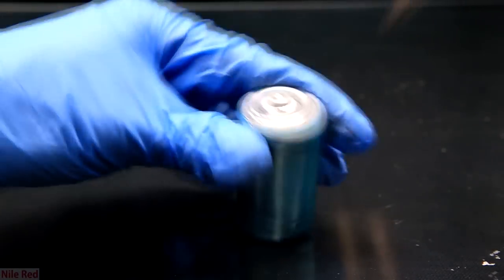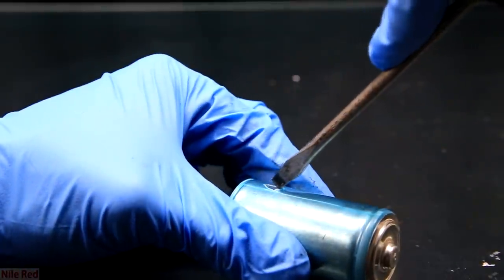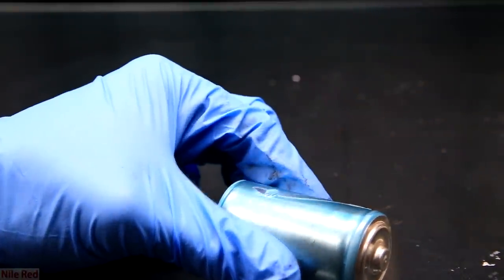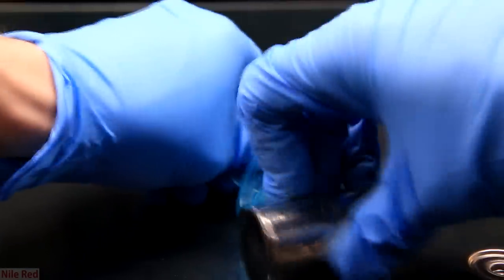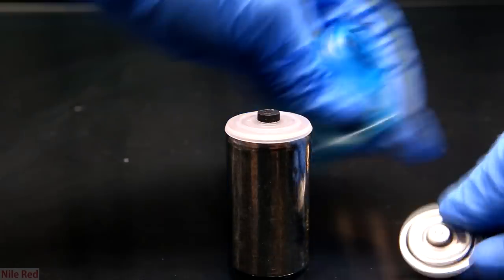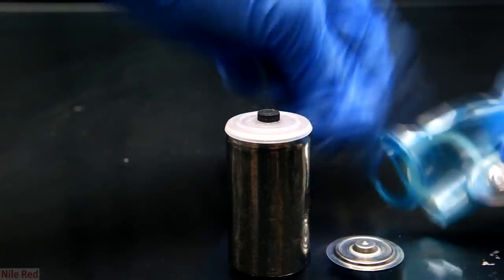So now we have our inner shell of the battery and the first thing to do is remove this plastic casing. The plastic casing simply serves to separate the zinc from the outer shell of the battery. Once the plastic casing comes off a couple other pieces fall off and these are also garbage.